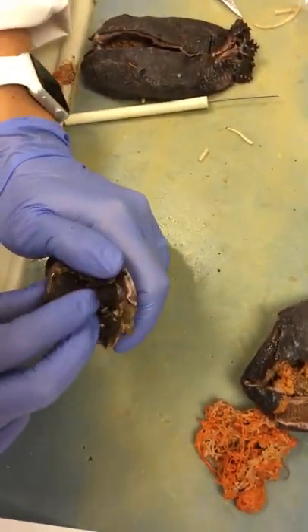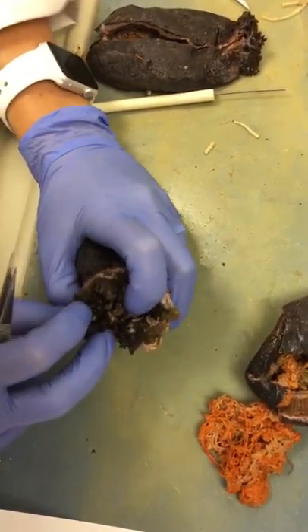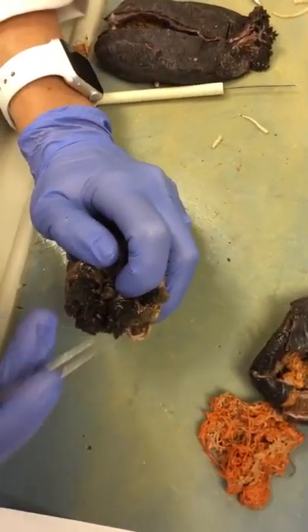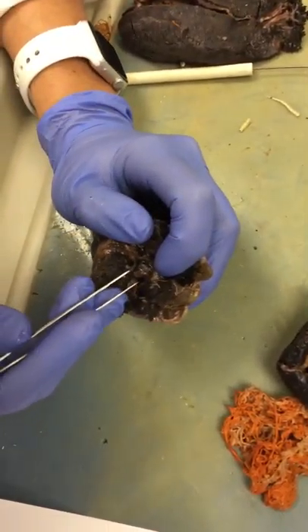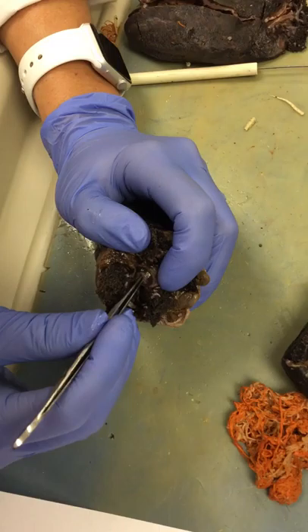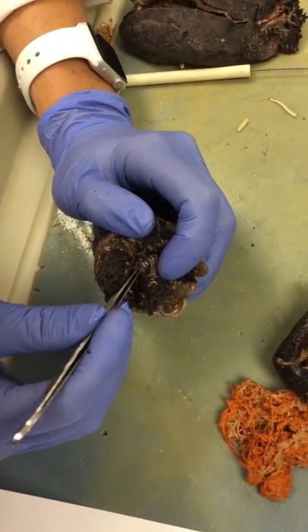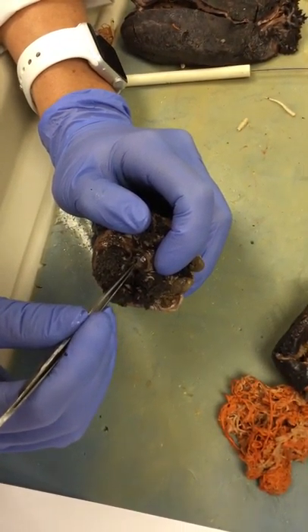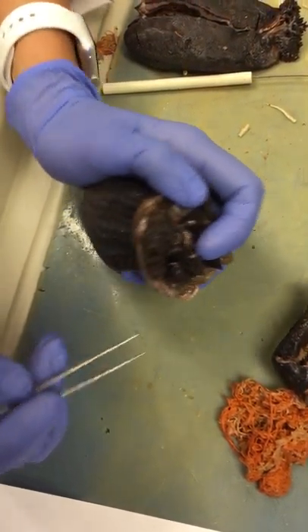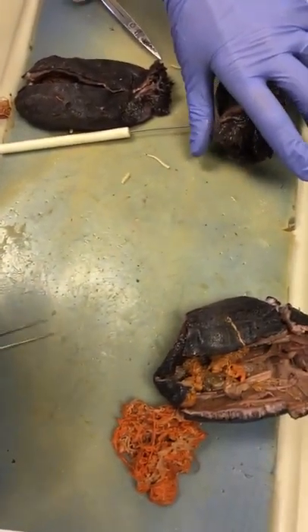These are feeding tentacles, and if I move them back, you can see the structure in the center, and this is going to be the mouth where the food is going to enter in. Remember, these are filter feeders. All right, so let's put this one away.